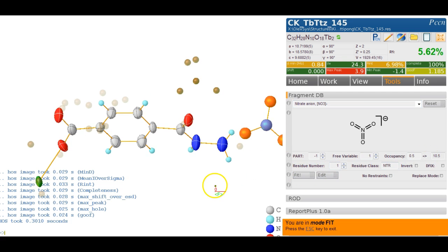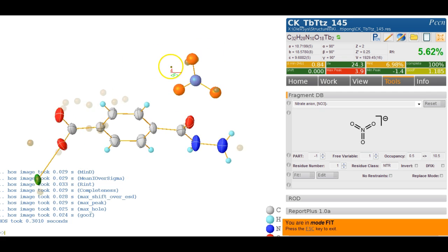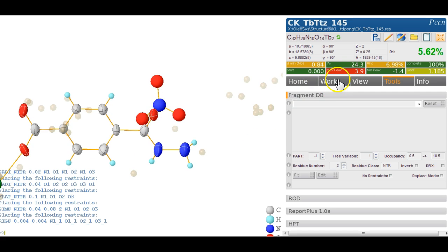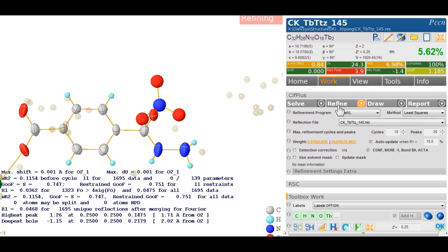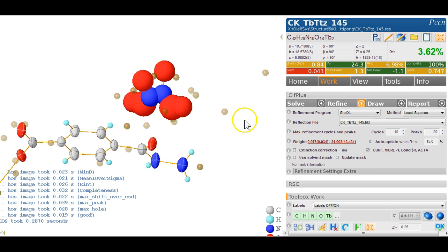So I click on that button, I align the nitrogen of the nitrate with the center peak, one of them with that, and then I just leave it where it is. That looks pretty good. Once you're done, you can click escape down here, and now let's simply refine this. Make sure we've got the right settings, ShelXL, that's fine, weighting scheme updating, that doesn't matter, Control R, refine it. And that shows us the grown structure, and that looks fairly good.